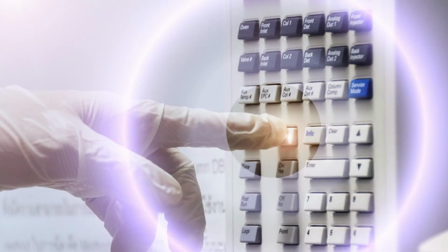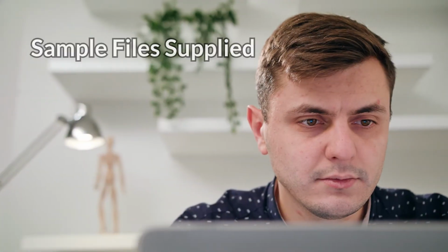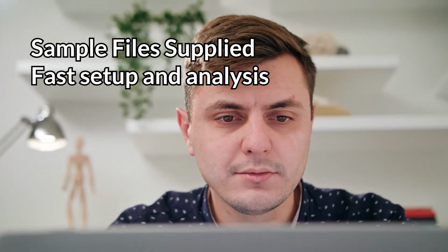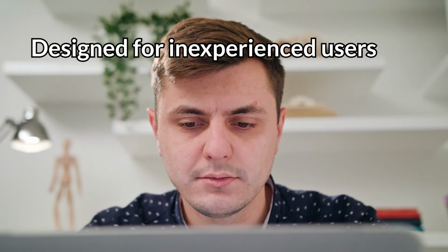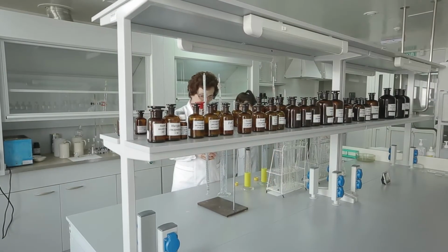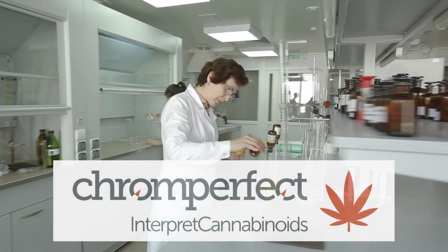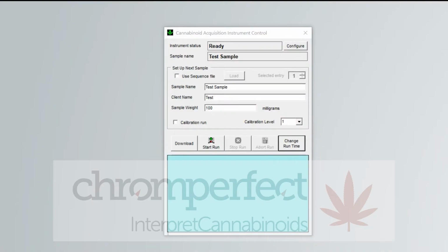InterpretCannabinoids is the complete turnkey software solution. A comprehensive set of Chromperfect files allows fast, automated, push-button analysis and reporting of cannabinoids. The new innovative design and user interface means that operators with no prior experience can get accurate results in minutes. In this video, we will focus on the key features and operation of InterpretCannabinoids from the point of view of a small laboratory operator.